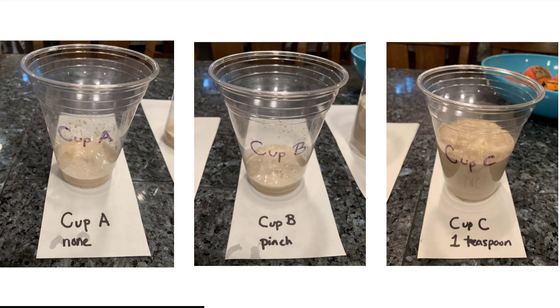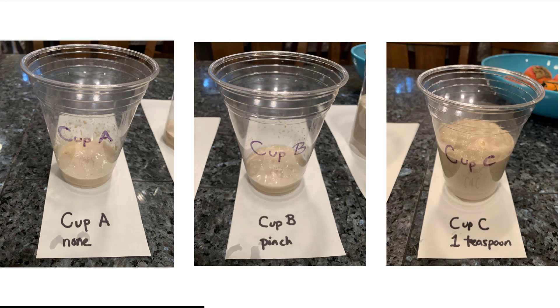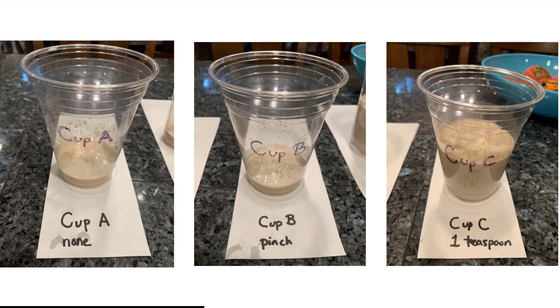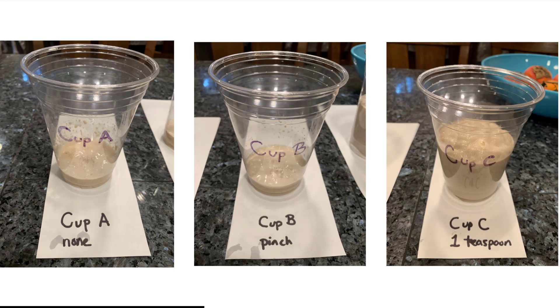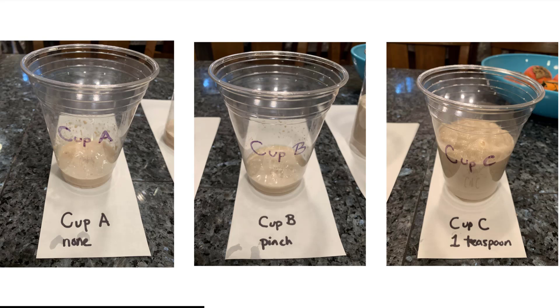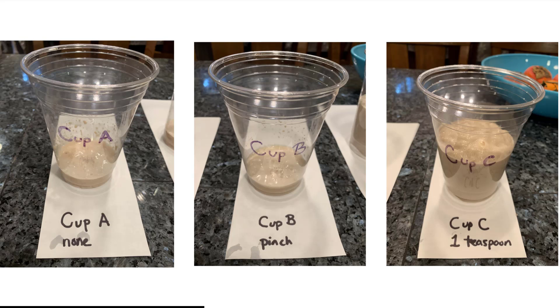Let's observe the results of the yeast experiment. Which cup of yeast showed evidence of releasing the most energy? Explain your answer. Cup C must have released more energy because it produced more bubbles.